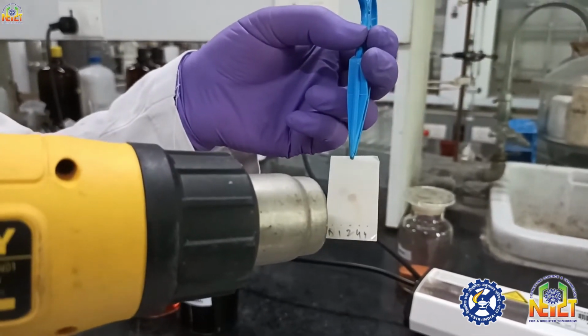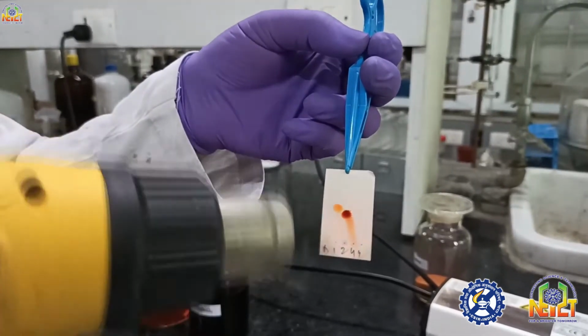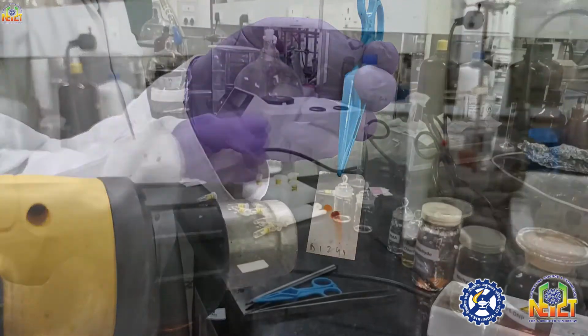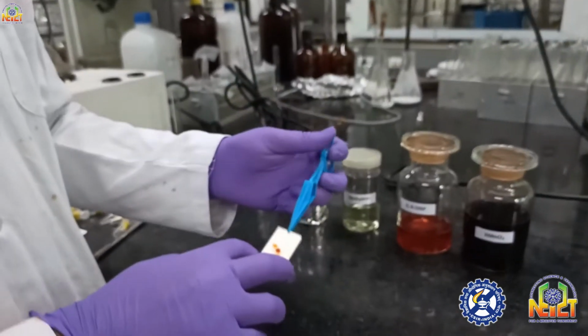You can see two spots are visible. I spotted five spots but only two are visible. That means they might be oxygenated compounds or nucleophiles. Other compounds are not para-anisaldehyde active, but they are visible in UV light. So if you want to distinguish the compounds, you can use a definite stain and say my compound is an aldehyde, an amine, or has an alcoholic group, or a phenol.